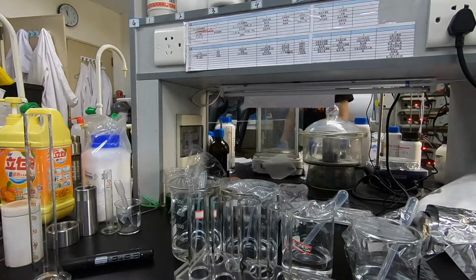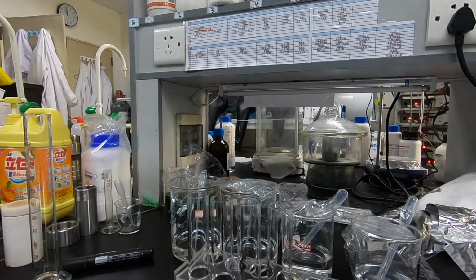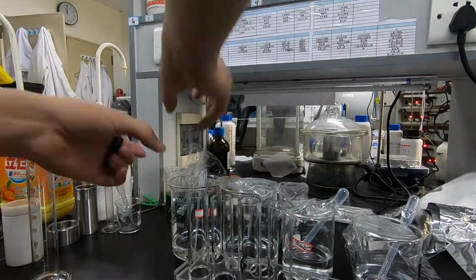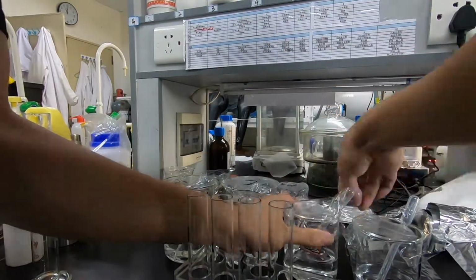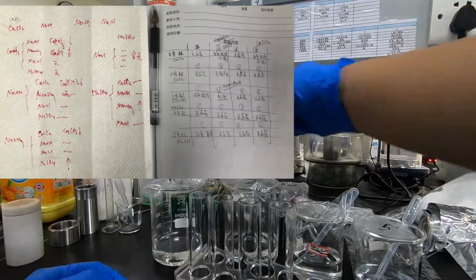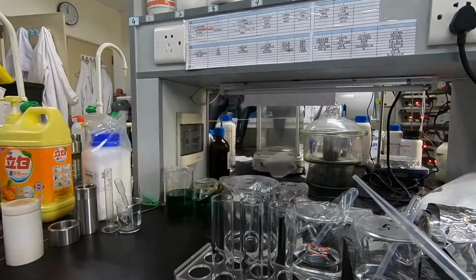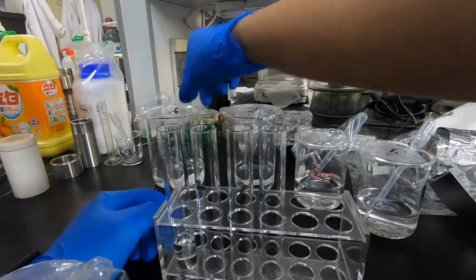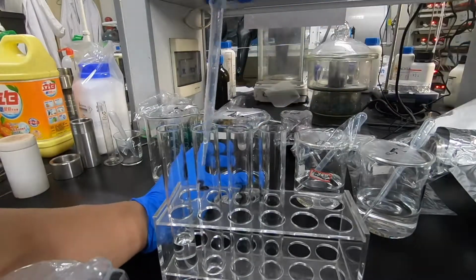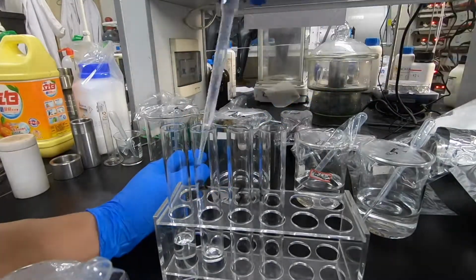You can see that I was preparing for the experiment. In this lab, we have 5 solutions, and each of them has a concentration of 0.5 mol per liter. I planned this experiment like this. I marked them from 1 to 5, and for each round we use 4 of the solutions and add them into the test tubes, and we use the left one to react with those 4 and see what reaction would occur.